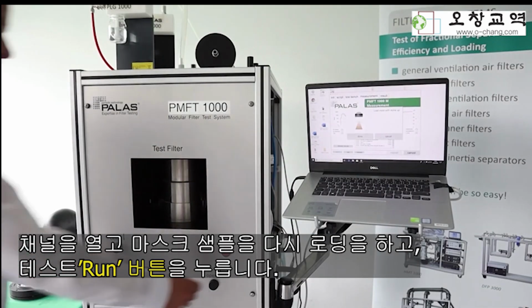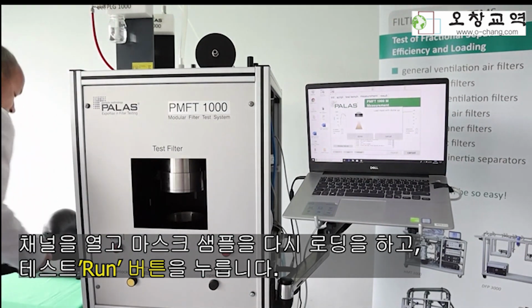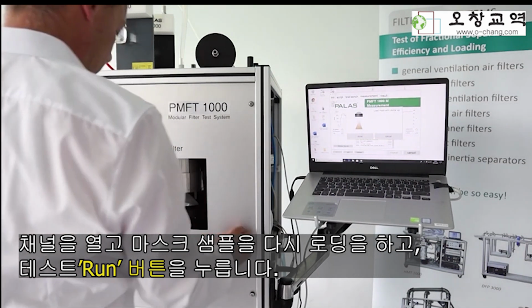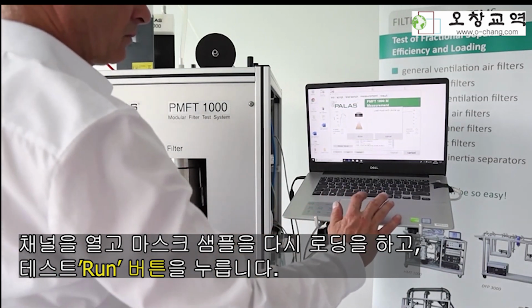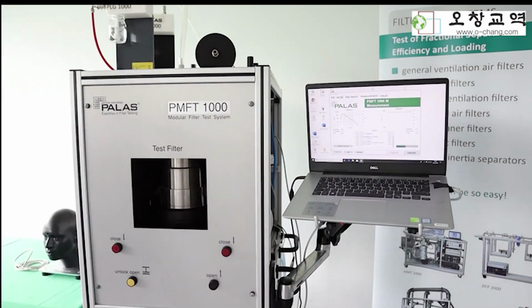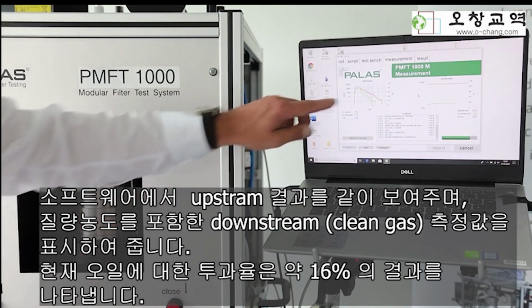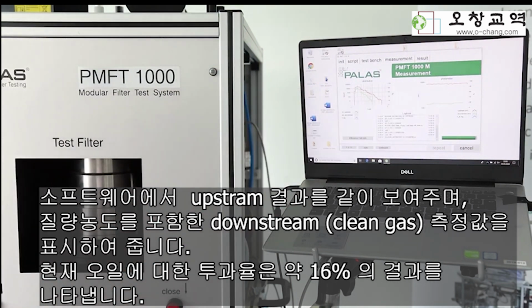After that is done, you open the channel again, insert the mask, close the channel, and run the test. After loading, the measurement process in downstream started automatically, as you can see it right now here. Here is now the distribution in downstream, and here you see the mass concentration from the photometer signal in downstream.